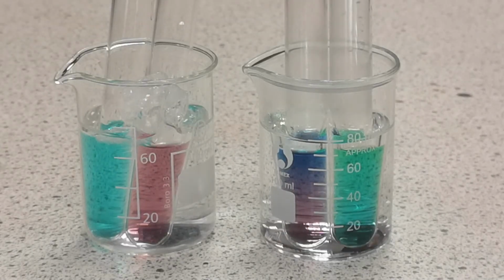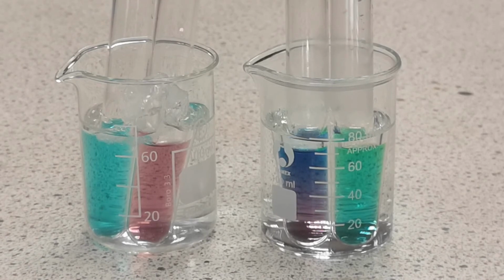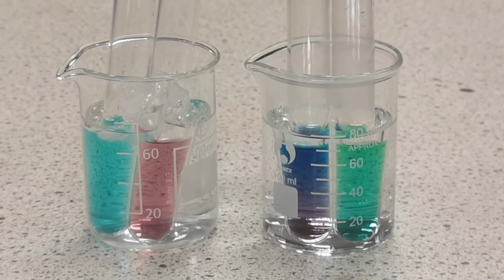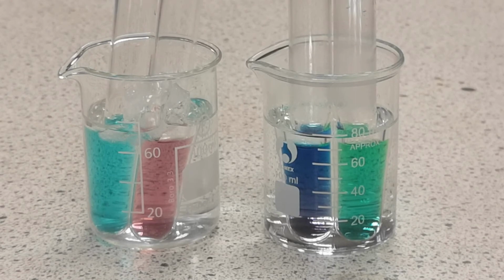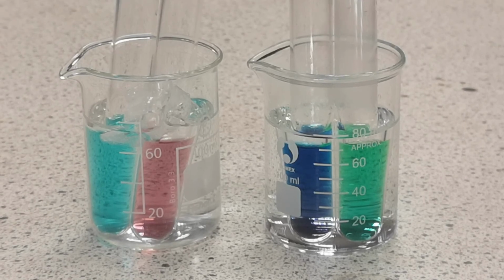You can soon see that the hot water pushes the equilibrium towards the chloride complex, the cobalt going blue and the copper going green, while the cold water favours the water complex, with pink cobalt and blue copper. If they are left to cool, both sets of tubes will return to their original colour.